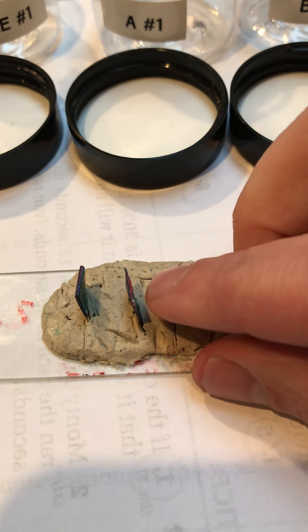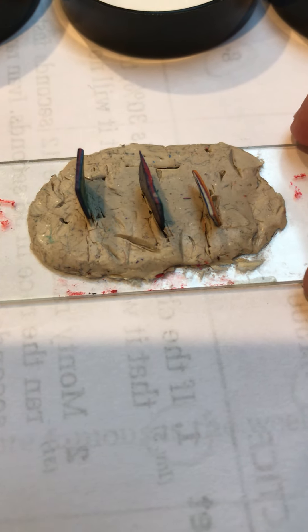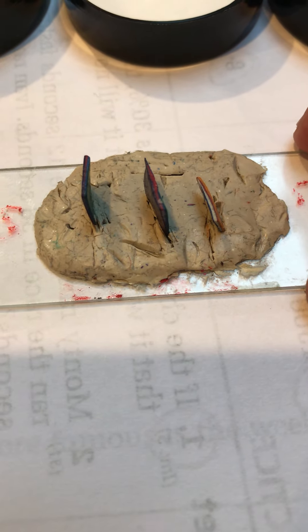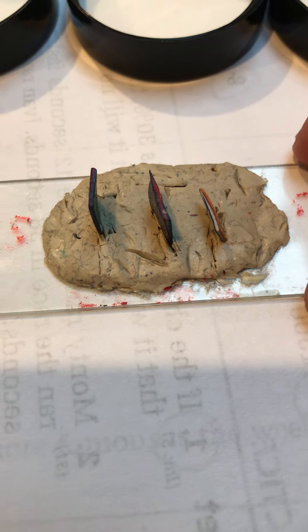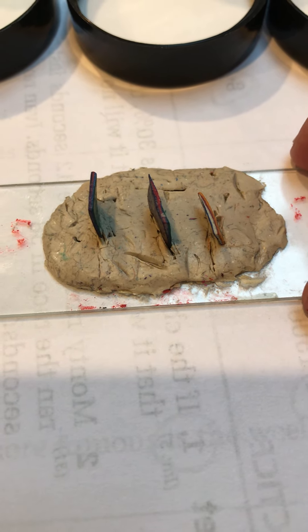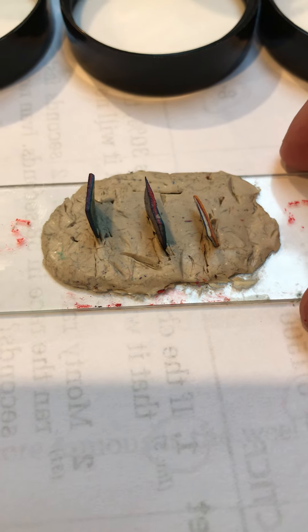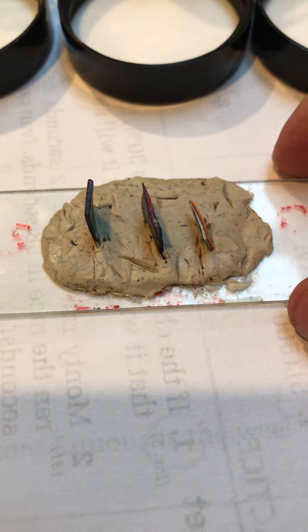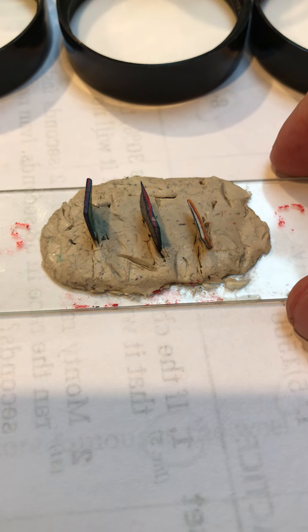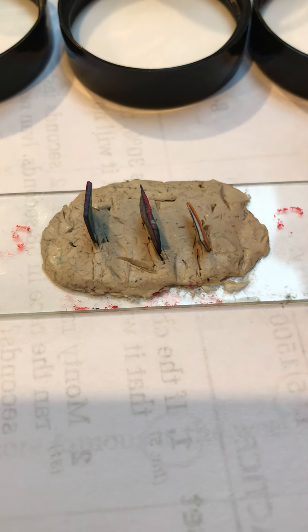Once we do this, we place them under a stereoscopic microscope and evaluate the colors and numbers of the layers, using them to compare our paint chips from the crime scene and our suspects. We're going to throw these under my high magnification smartphone and take a look at some pictures to evaluate.